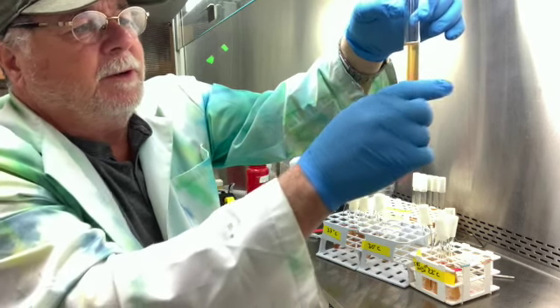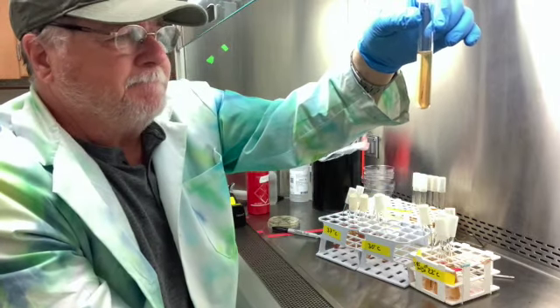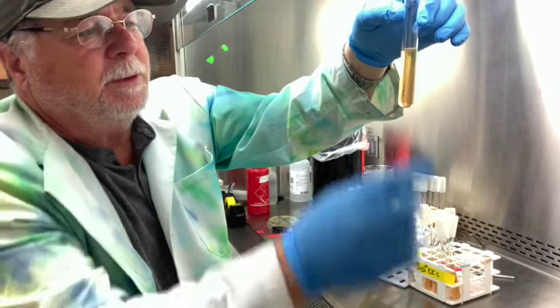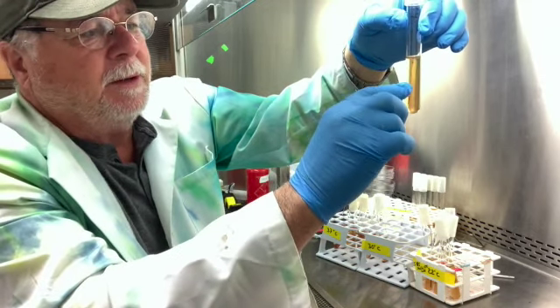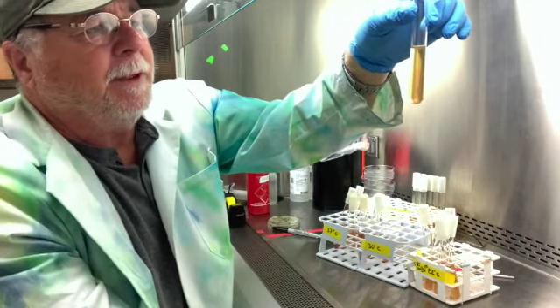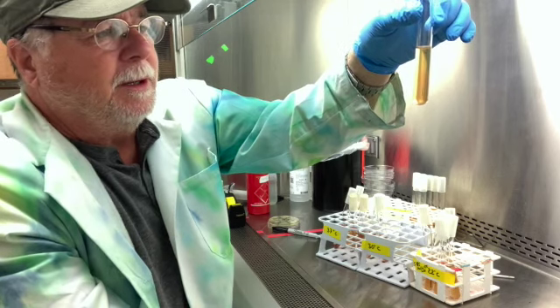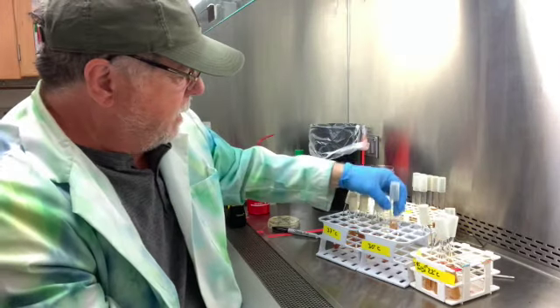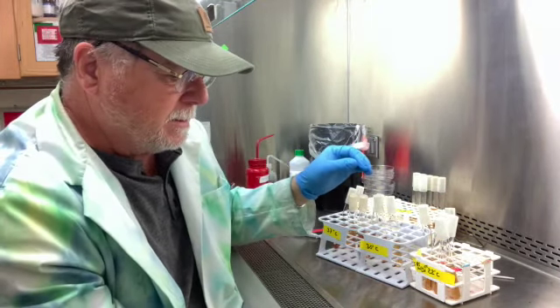So this is really going to be an aerobe as well, because we don't see it really growing all the way along this. And so this is an aerobe, and it is non-motile. That's number seven, Micrococcus luteus.